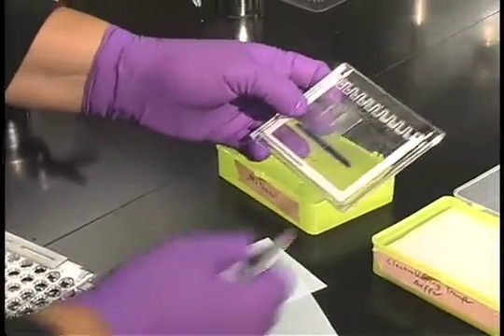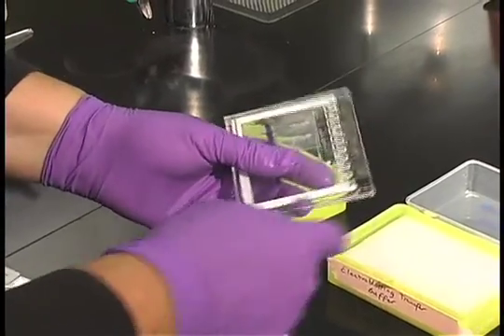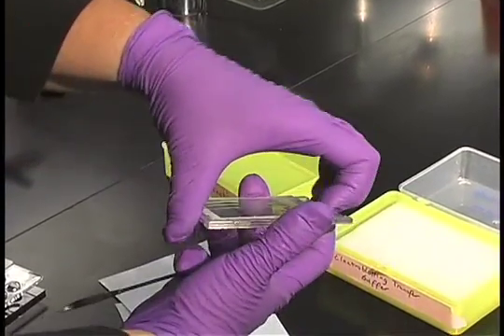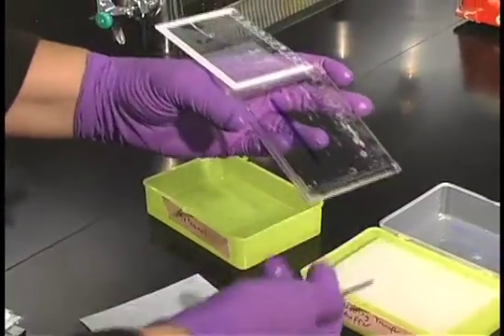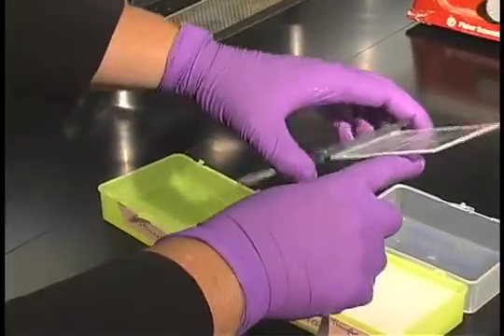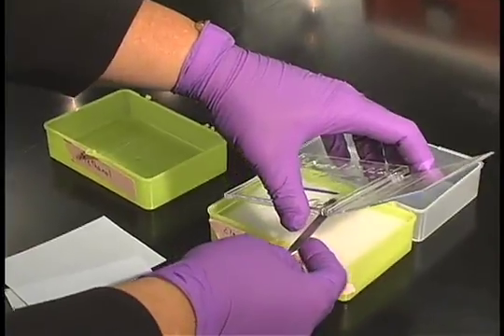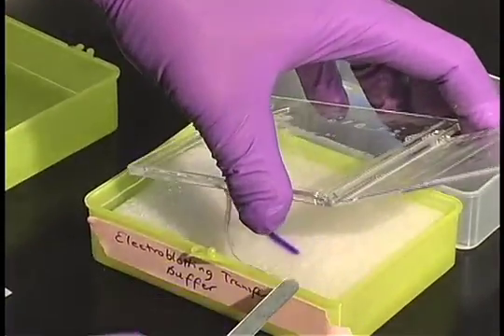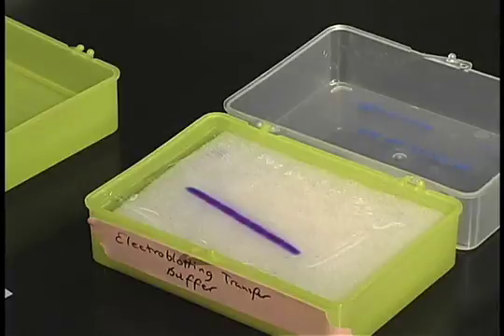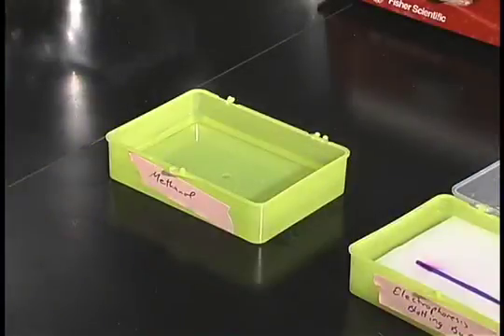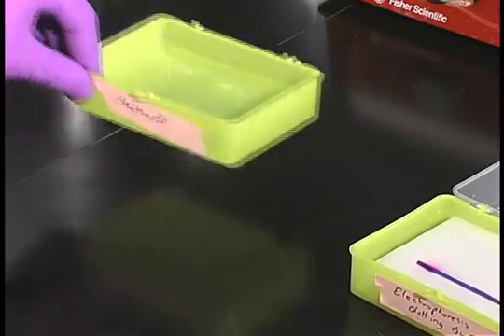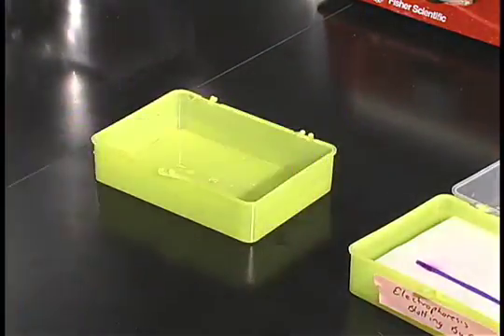The gel has been run and we remove the gel from its cartridge and we'll soak the gel in your electro transfer buffer also.